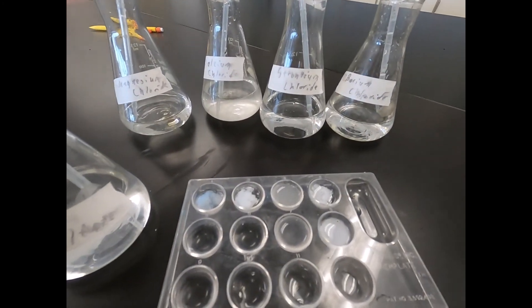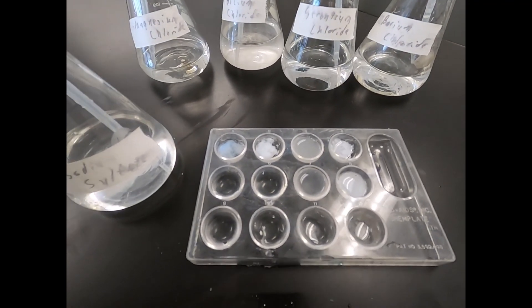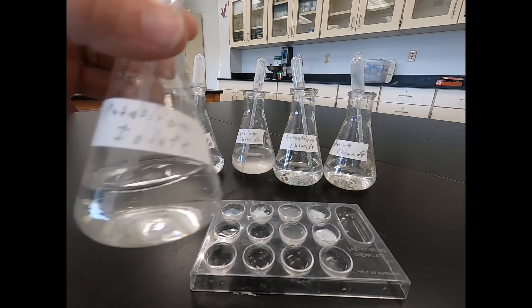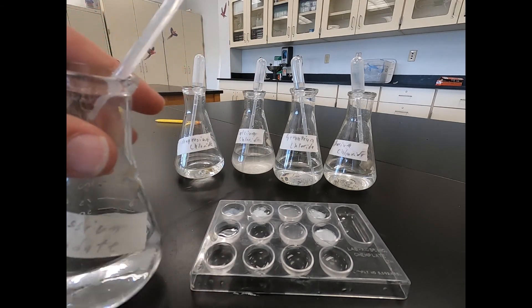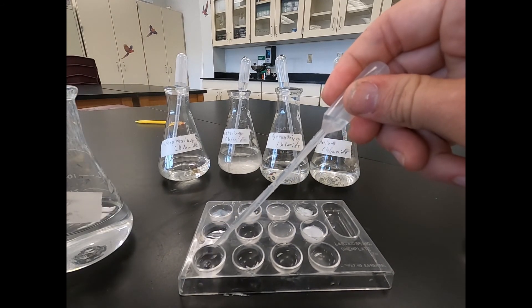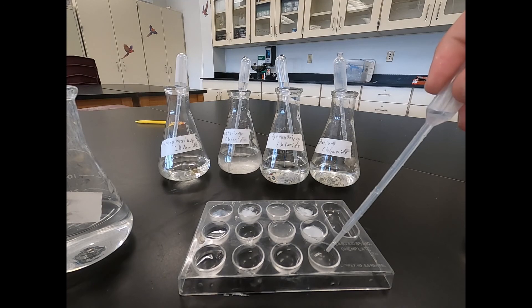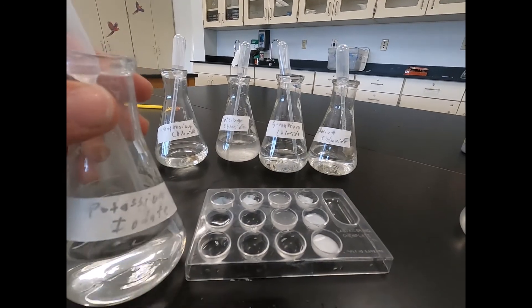Next we'll do the same process with sodium sulfate. In this case you can see some of them reacted while others did not — we're looking for that white cloudy appearance for a formation of a reaction. So that was sodium sulfate. Our final one, we're going to use potassium iodate. Again, it's a clear colorless solution, and we're going to go across all four of our test solutions. So that was potassium iodate.